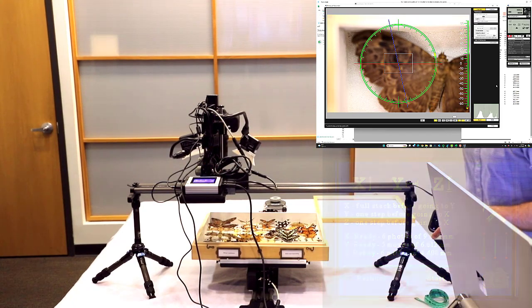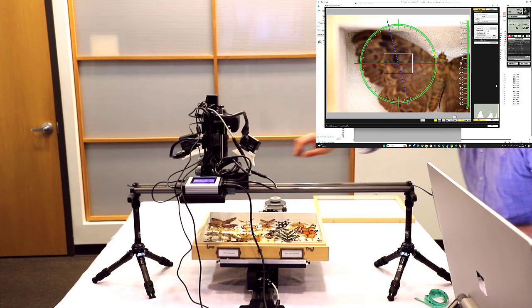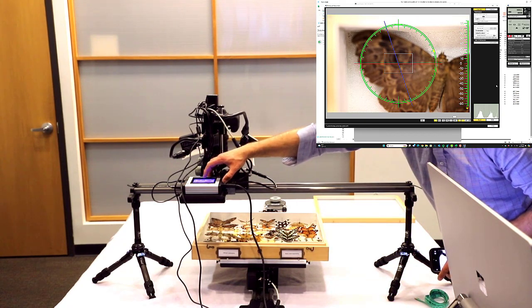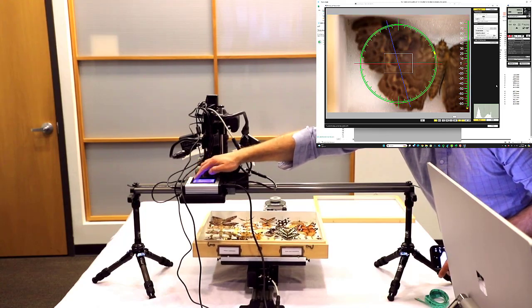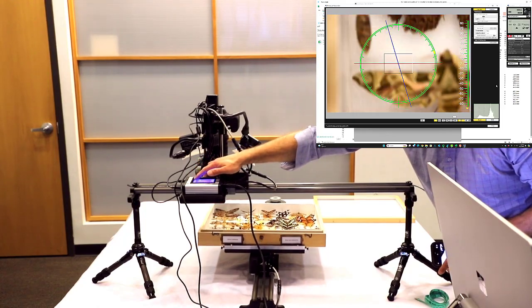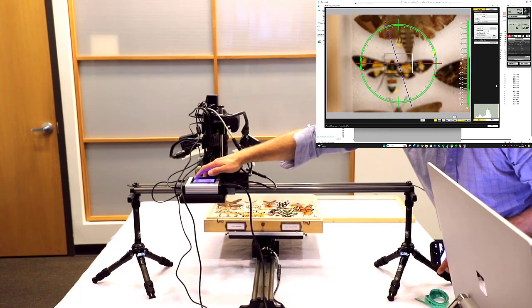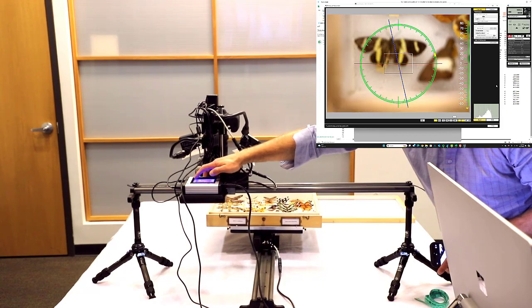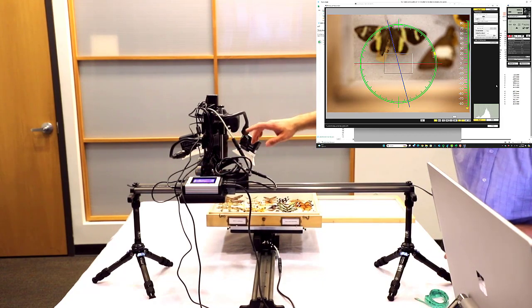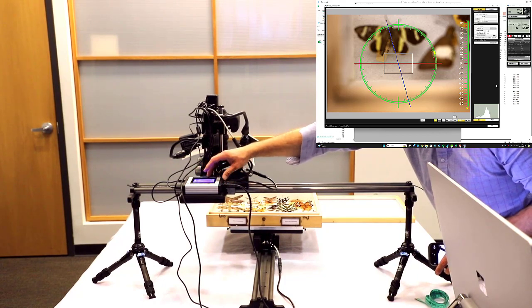Now what we want to do is focus on the right side of the box in the lower left-hand corner. So we're going to now click on the Z-axis, and we're going to bring the box up until we're focused on the bottom left edge. And again, this is also where you can check that your cables have enough clearance. Test that bottom left, that's going to be our end.